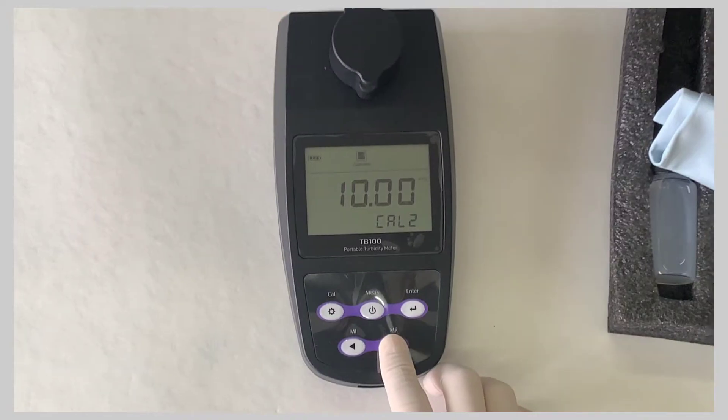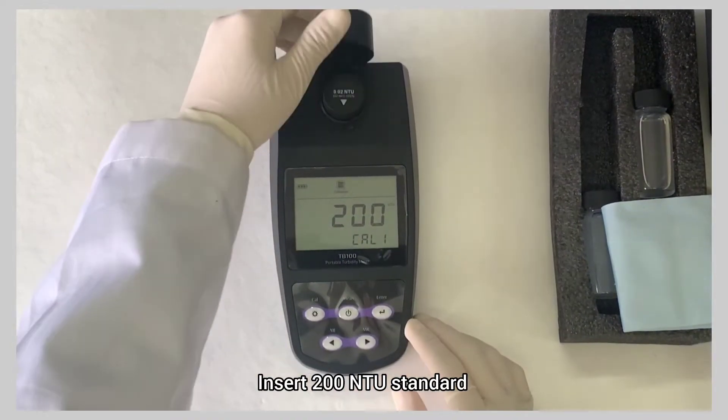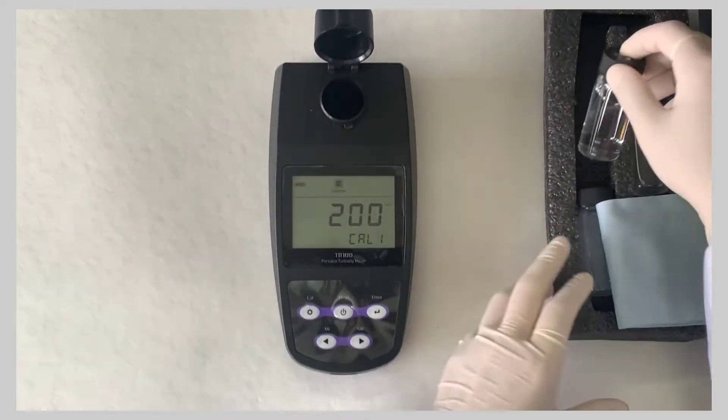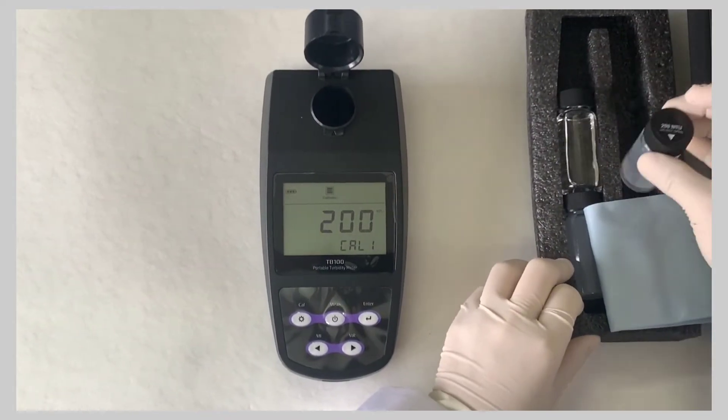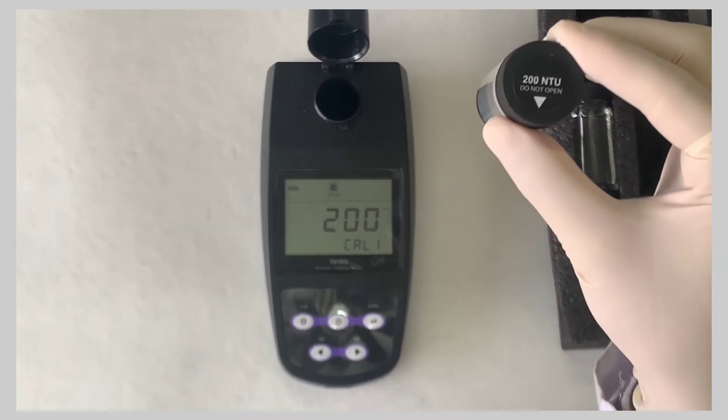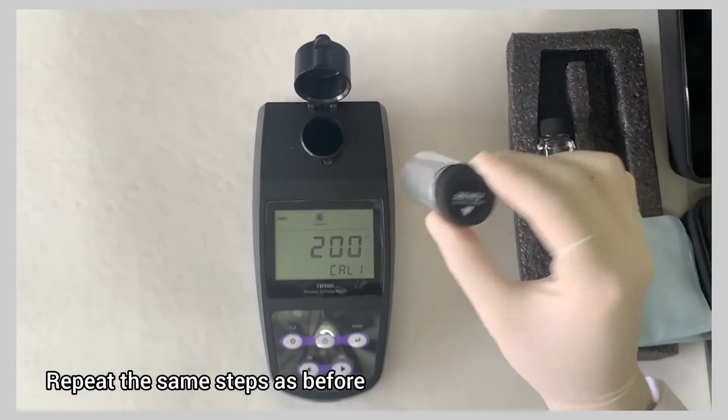Insert 200 NTU standard and repeat the same steps as before.